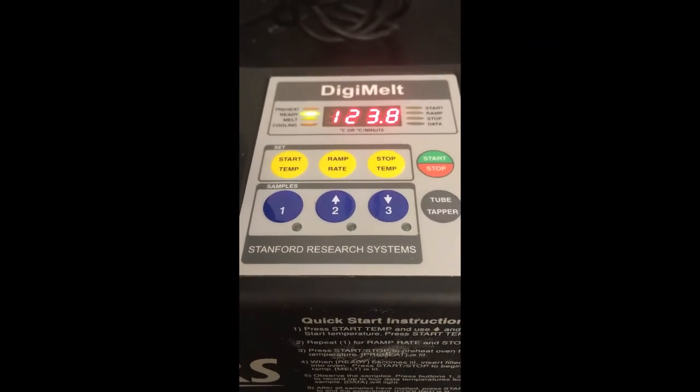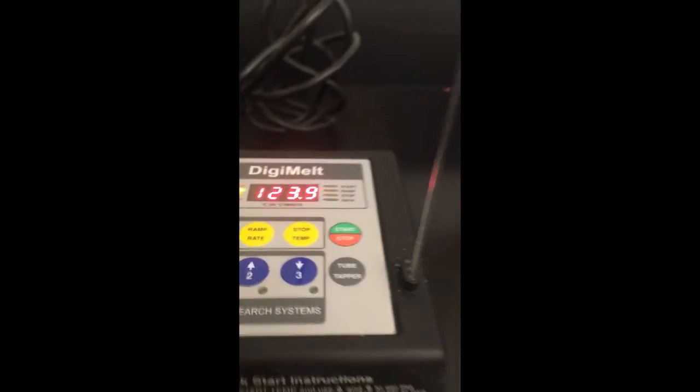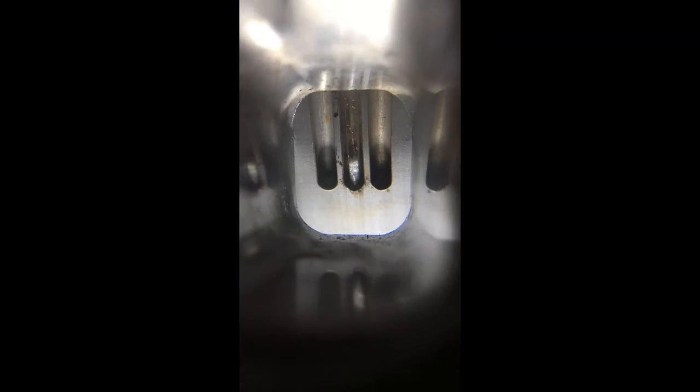Alright, so it's been a couple minutes, but our instrument is now heated up and ready to go. You'll notice the green ready light has turned on. So I'm going to take my sample and insert it in one of these 3 holes in the top of the melting point apparatus. As I insert it, notice if we look through the viewfinder, we can actually see our crystals inside the melting chamber.